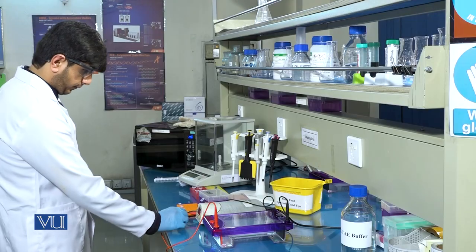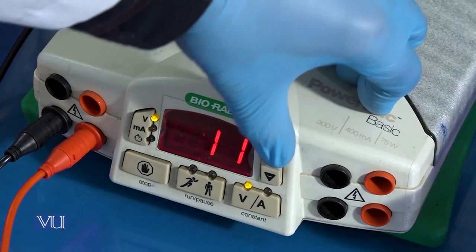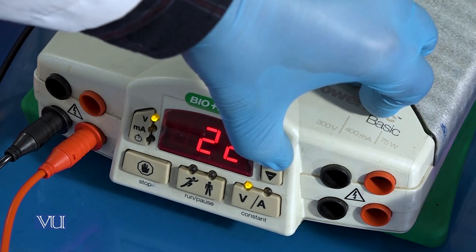Gel will be run at 90 volts for 30 to 35 minutes.